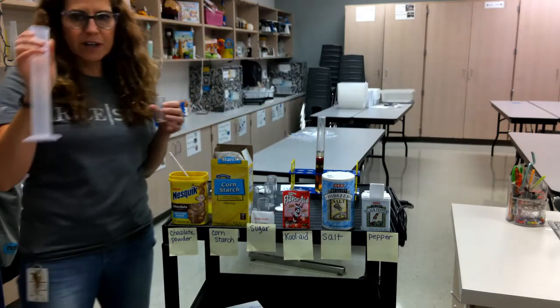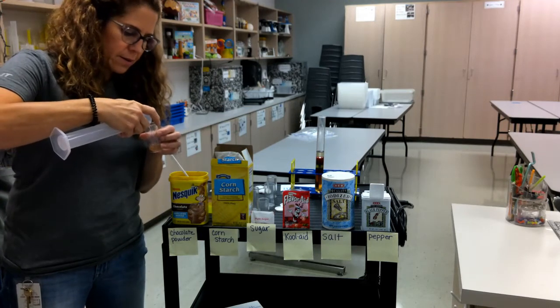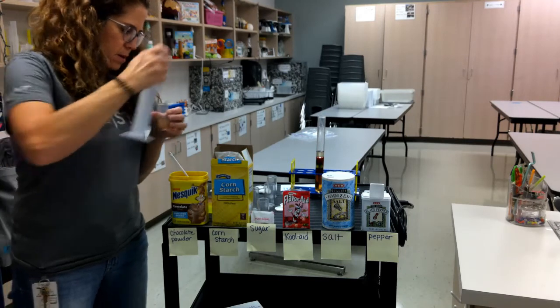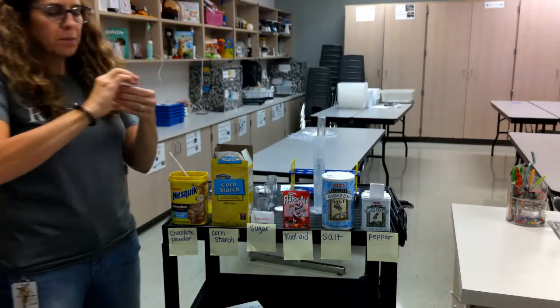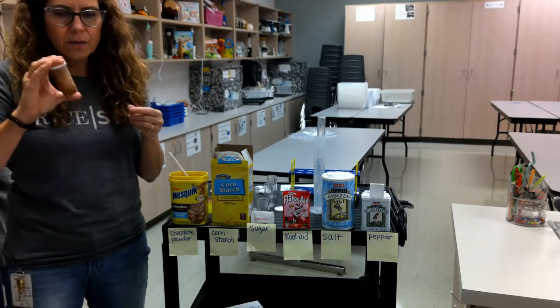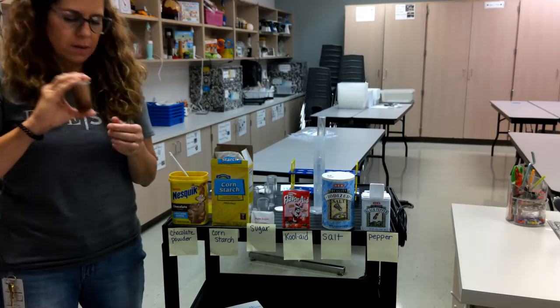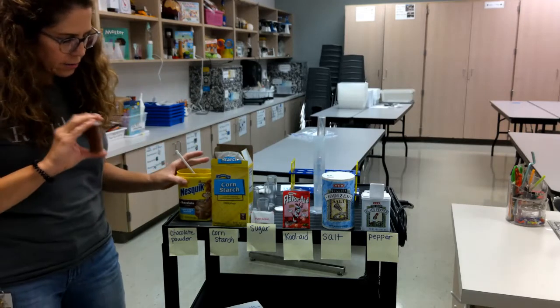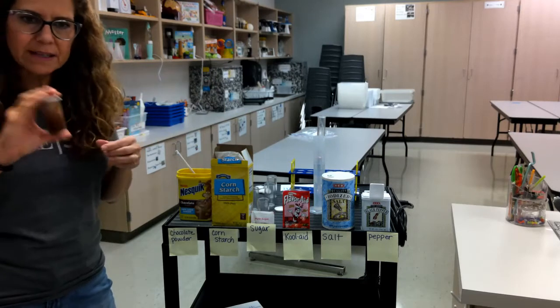I have my graduated cylinder that we're going to, full of water, that we're going to add. I'm going to fill it about halfway full. I'm going to put the lid on. We're going to agitate it or shake it up. And then we're just going to let it sit here until we do the rest of the powders. And then we'll come back and see what happens.